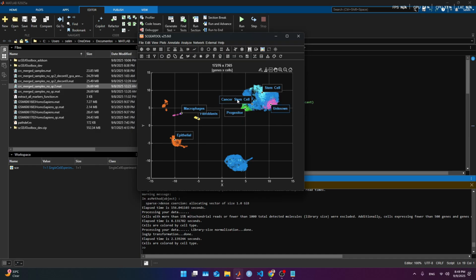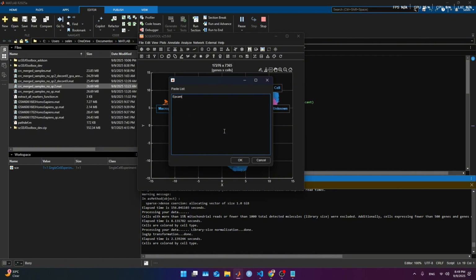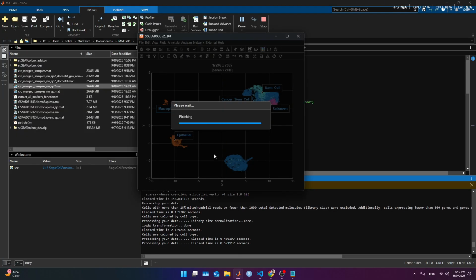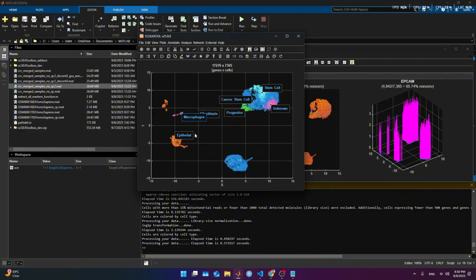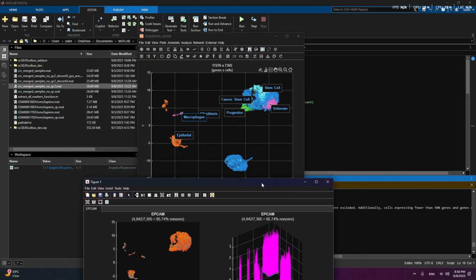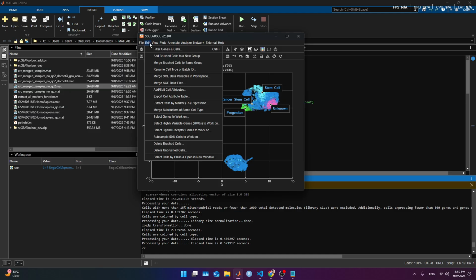And here is something I wanted to look at before. The EpCAM expression again. All right. If we look at it again, it cleaned up some regions. For example, here where macrophages were, no macrophages, no. Some epithelial, which is not good. There should be a lot of EpCAM expression in epithelial cells in the colonocytes here. So what happened is that it didn't help. What this is pointing out is that potentially it is a really low quality set.